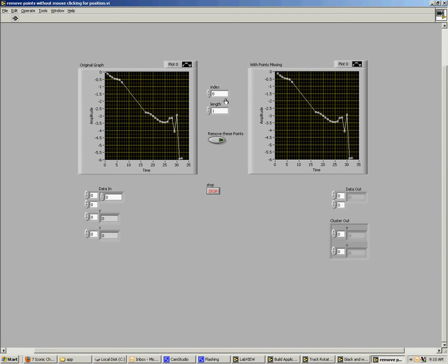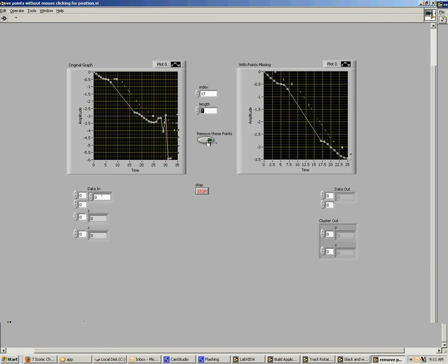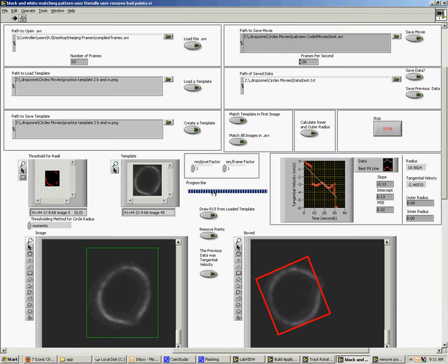Now I can also remove these points at the end by doing the same thing. There we go. Now when I'm done, I can click the stop button. If I click this button before that, I'll just have to make this length 0 and click this stop, because this actually removed the first point, as you watch here. So I click this button, and there's our new data. Now we have a slope of 0.15 and tangential velocity of 2.9, and it's looking pretty good. A lot better than what the previous was looking like.